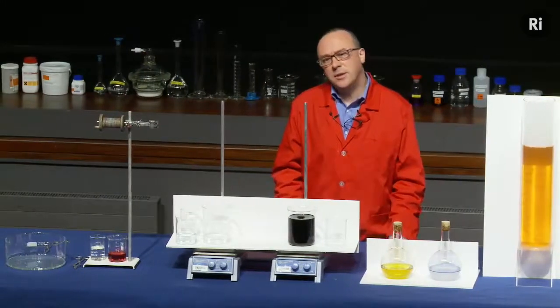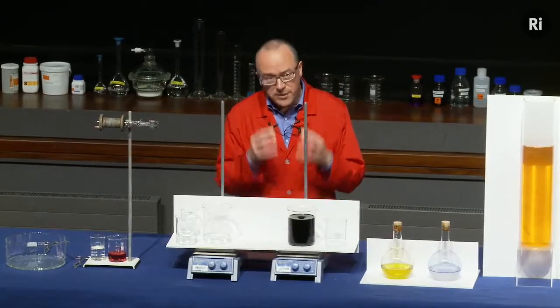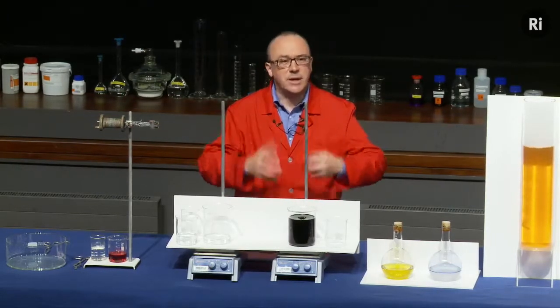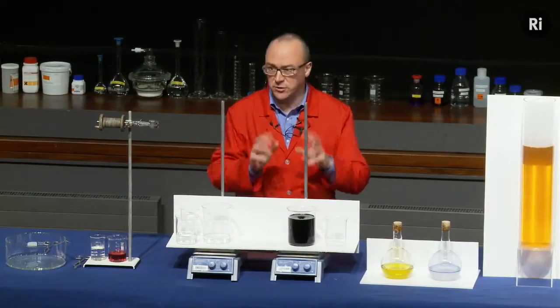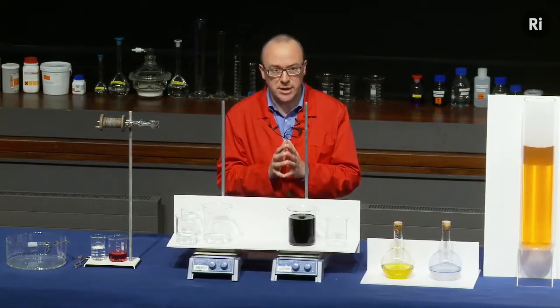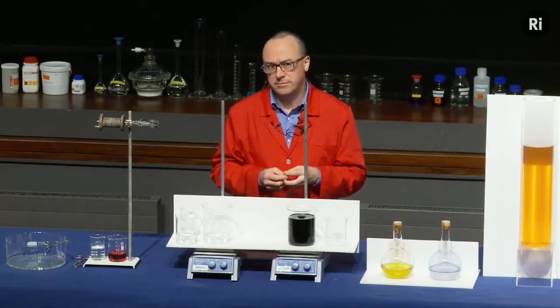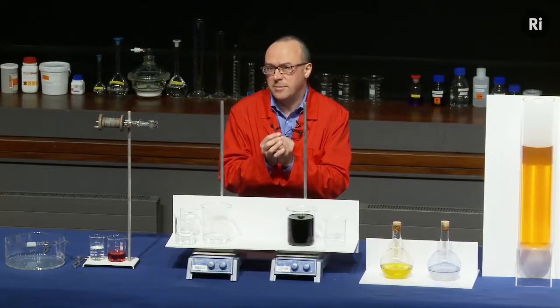What was really going on is that there were actually two different chemical reactions taking place inside this beaker. The first reaction was quite a slow reaction. It was a reaction between two chemicals that produced iodine. So you imagine this reaction taking place and slowly releasing iodine into the solution. Now the iodine would appear as a sort of brown colour. You can't see the iodine because there's a second chemical reaction taking place. There's a material in the solution which is reacting very quickly with the iodine, and it's absorbing the iodine as soon as it's produced. And the secret to this is to arrange that that second material is in short supply.